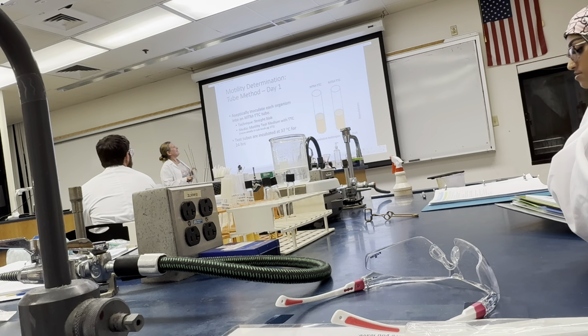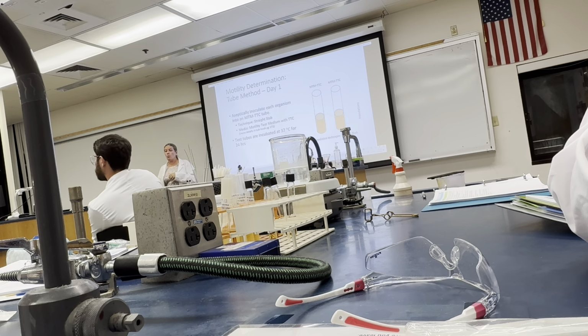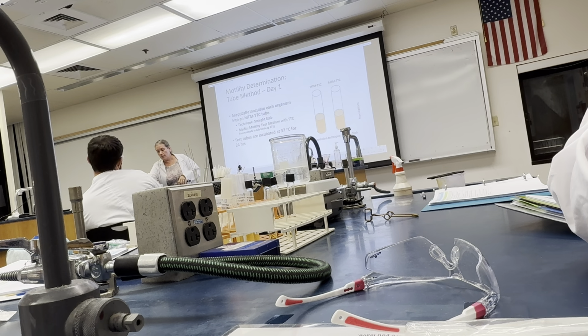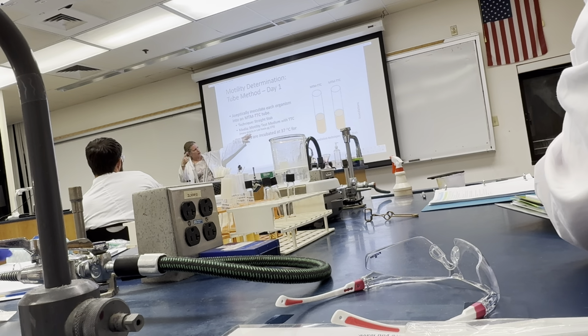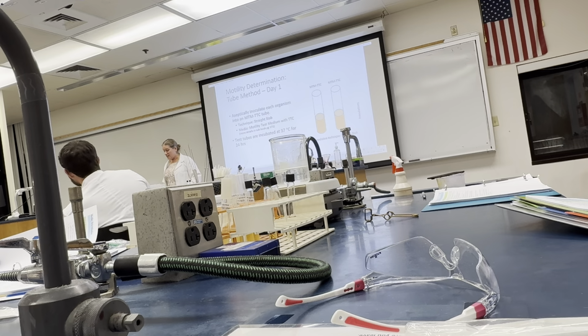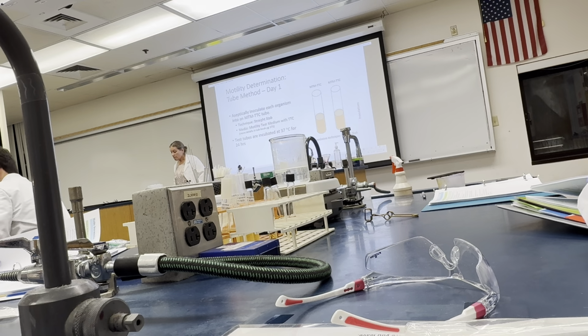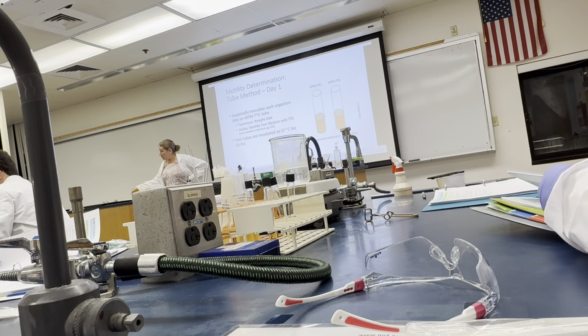Anyways, the tube test is pretty easy. Again, everyone's going to do one. The motility test medium is abbreviated MTM. It's with TTC. And by the way, you might have noticed I've got a location for 171. It is one of the tests we'll do for the unknown. So if you go to page 171, you'll see a lot more detail in regards to the purpose, the description of the test, etc. So I like to reference that.